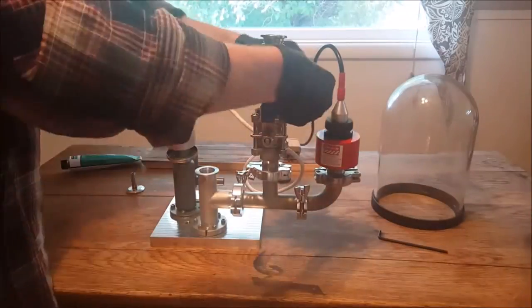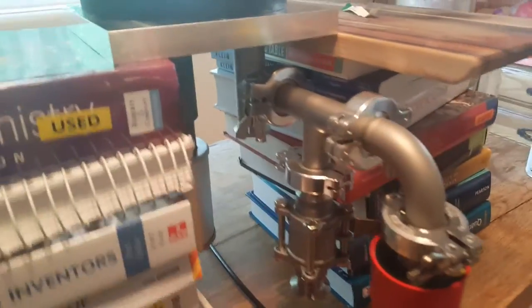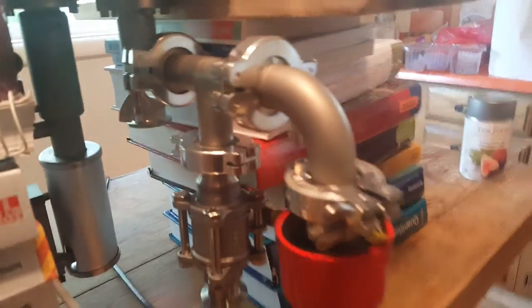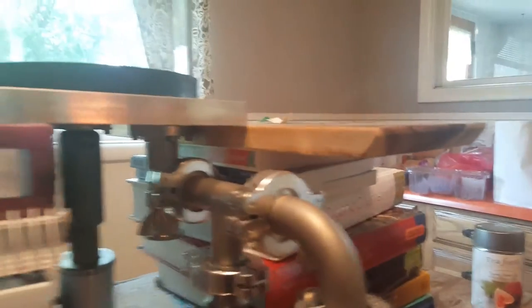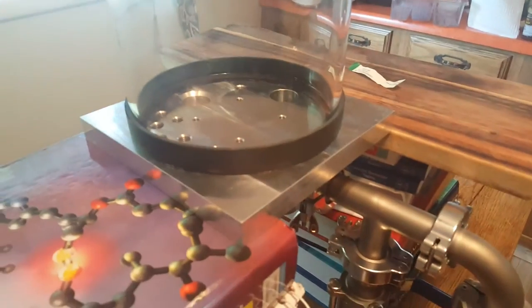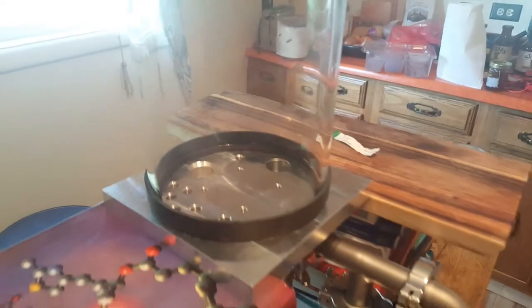The penning gauge is going on and we're done. With enough textbooks for support, I was actually able to get it standing up. This is kind of what the undercarriage will look like once it's righted, and here's the top of it. As you can see, it's very tight quarters and very crammed in there, but I hope to utilize all of the bell jar space to try to get a good SEM.